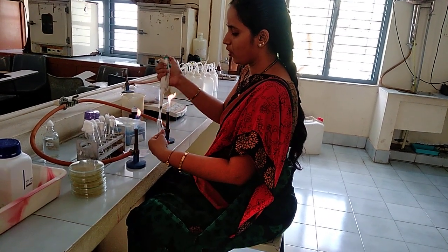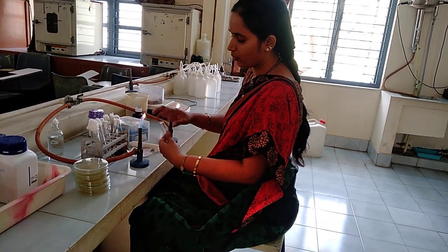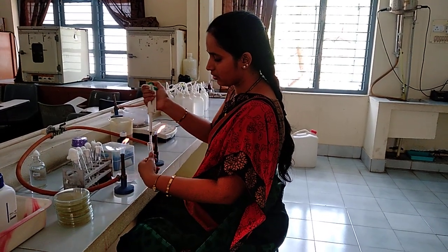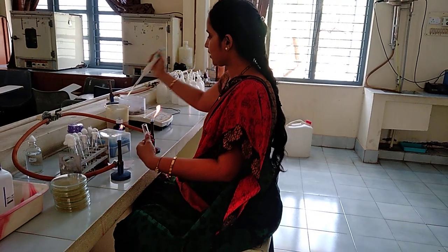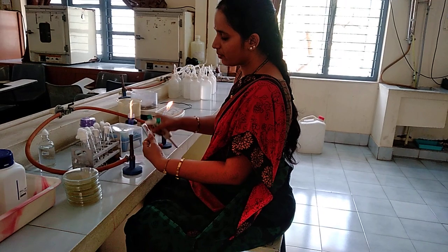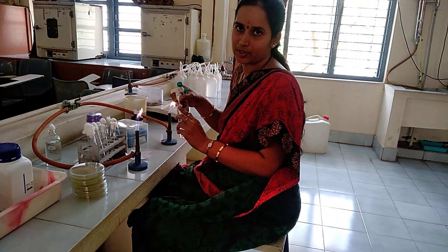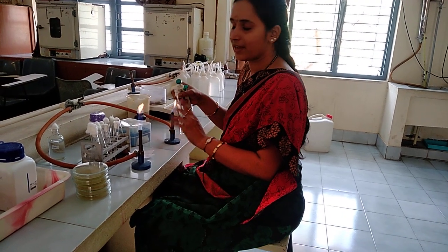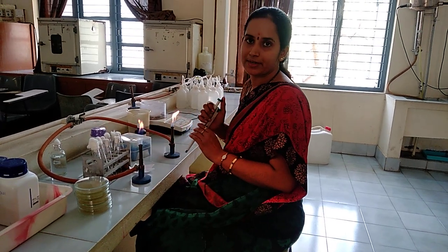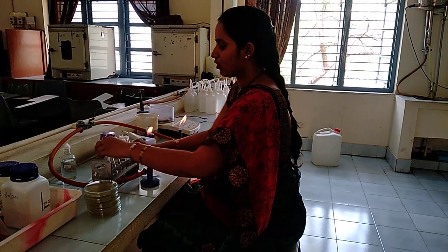You can go up to 10 to the power of minus 10 dilution if you are interested, but here I am showing only up to 10 to the power of minus 5 dilution. From the last tube, always remember to take out 1 ml sample and discard it — then only will it become that respective dilution. Now we are done with the serial dilution of the soil sample.